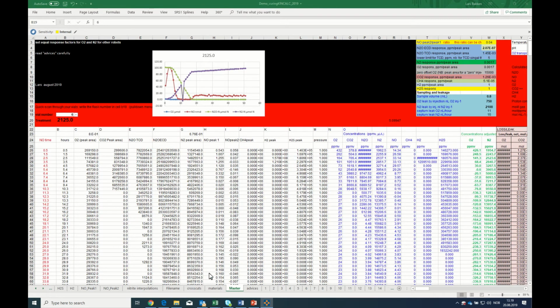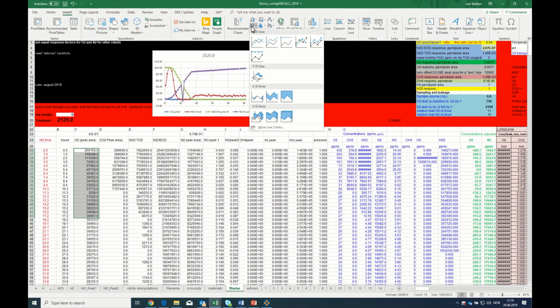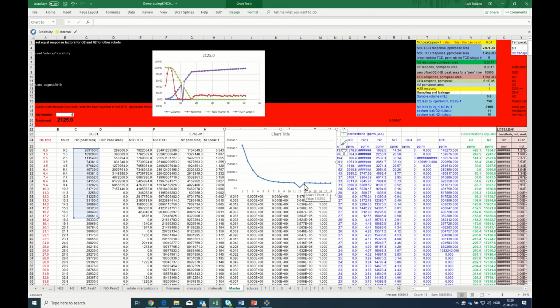Now I move back to the master plot again, and try to see what we can do with number six, because there was obviously something funny going on after 11 hours. All of a sudden the N2 disappears, the N2O disappears, and if we look at the oxygen curve, it also looks a little bit funny. This is the oxygen signal, and this is how it looks. If I plot the oxygen signal, I get something like this. There's something funny happening here, and that applies to all the gases. N2O disappeared, and even N2 disappeared.